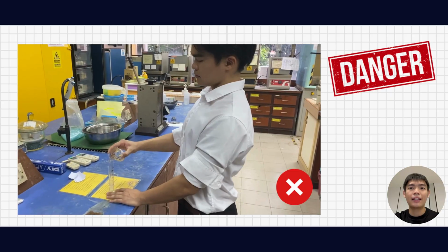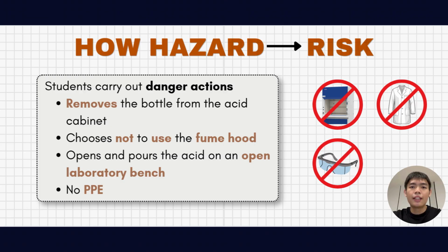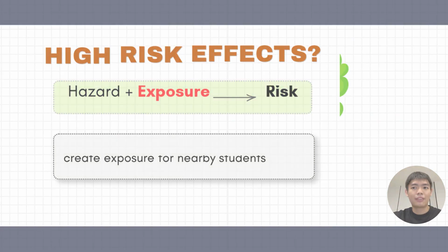Can you guess why the situation is risky now? Hazards and risks are always related to each other. In the video, the student carried out several unsafe actions, including removing the acid from the cabinet, choosing not to use the fume hood, pouring the acid on the open laboratory bench, and wearing no PPE. These actions create high-risk conditions, which means that the acid vapor now escapes into the laboratory and creates exposure to the nearby students. In short, when hazards come together with exposure, risk occurs.